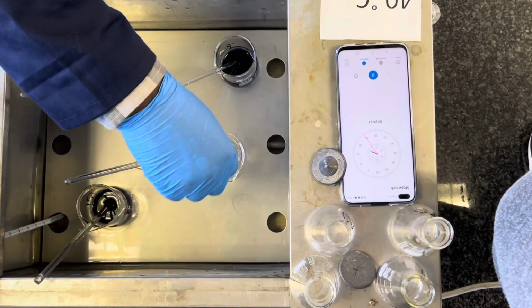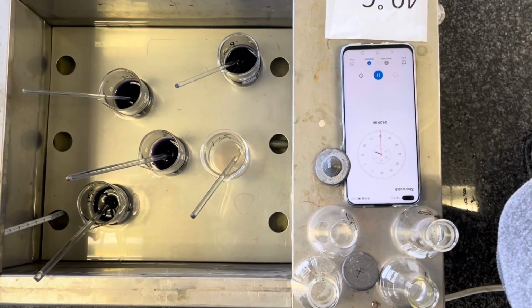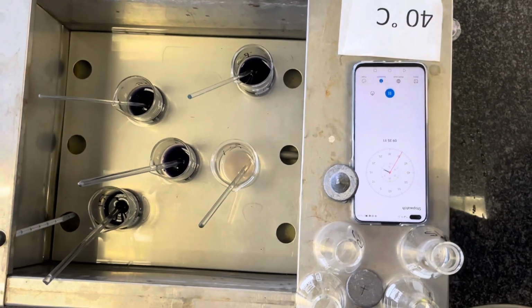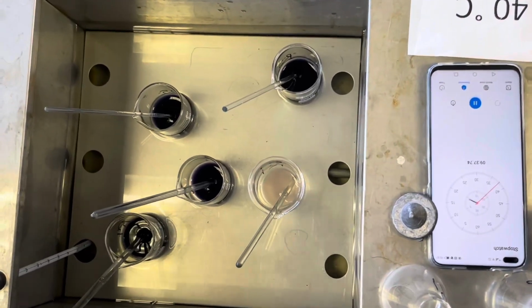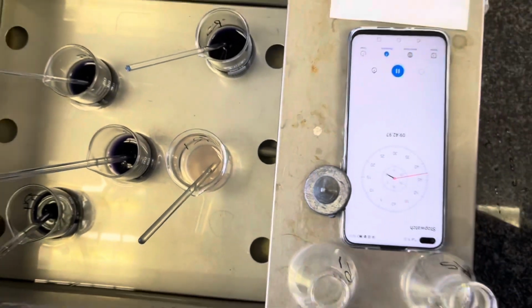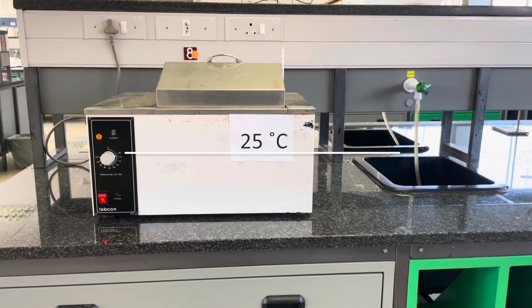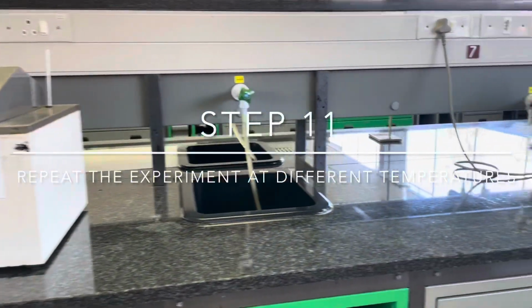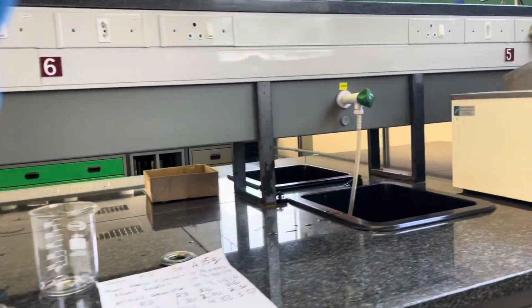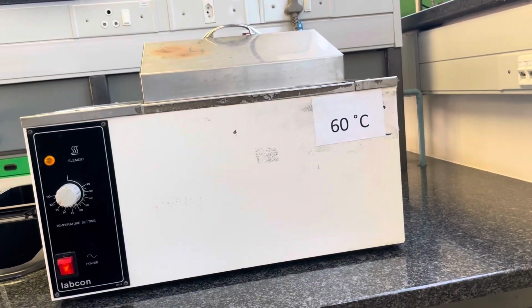This deep blue color, as you can see for most of them, will appear periodically at different times, which you note down, and of course the difference between their starting time and their final time is the length of the reaction. Once the final reaction mixture has changed color or started to change color, note down that final time and then you may proceed. You will proceed to do this for all three temperatures indicated in the practical manual: 25 degrees Celsius, 40 degrees Celsius, and 60 degrees Celsius, following the exact same procedure.